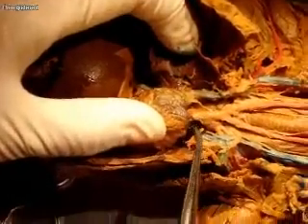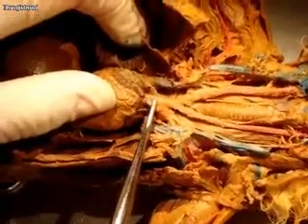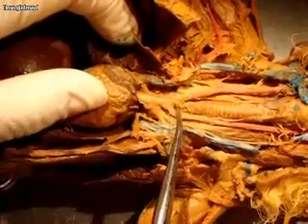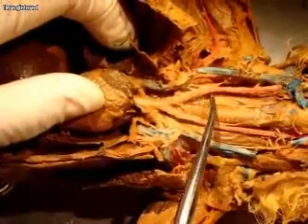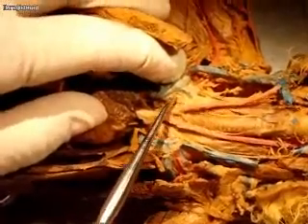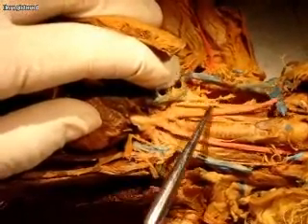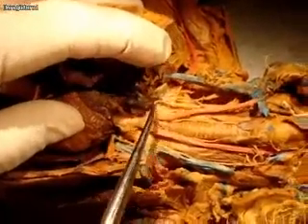Coming up here, we have the aorta. The ascending aorta is very, very short, and then it very quickly becomes the brachiocephalic artery. The brachiocephalic artery is going to branch to form the right and left common carotid arteries. And on the right side, the common carotid artery then branches further, right here — this is actually the right subclavian.